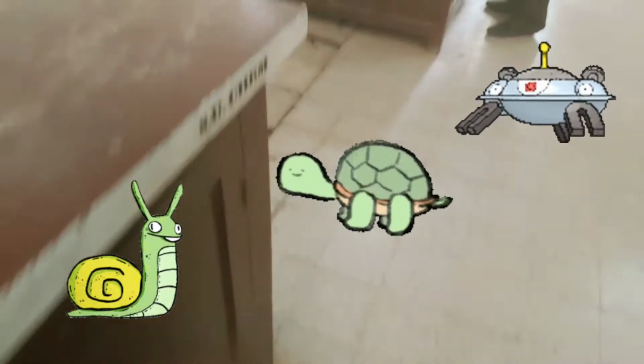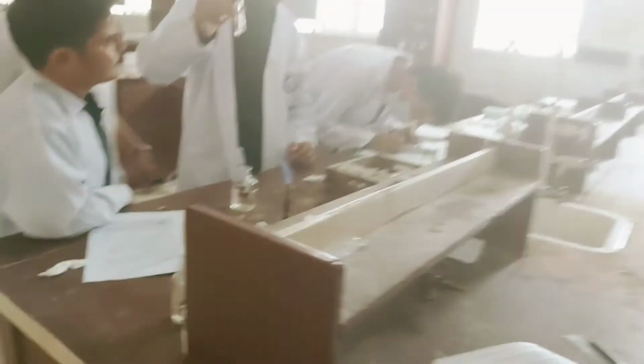Today my girls are a bit slower. I don't know, maybe they didn't have a proper breakfast. Maybe something is wrong. They are a bit slower. They have not started the solubility test up till now. Whereas the boys are just running from one corner to another, the boys are a bit faster.